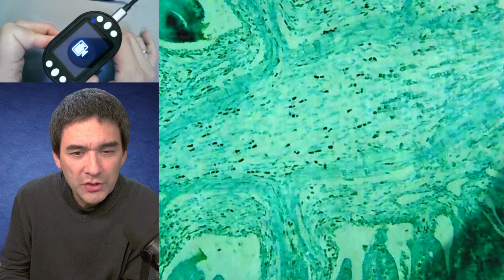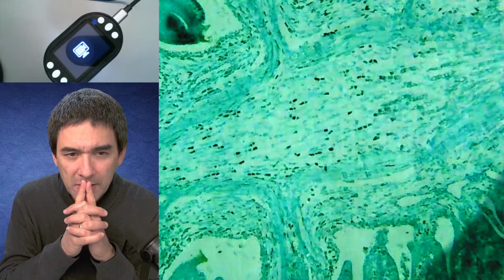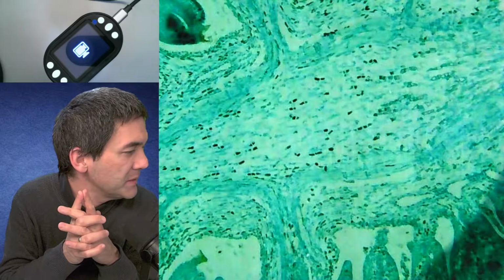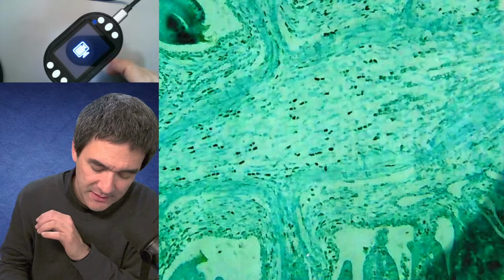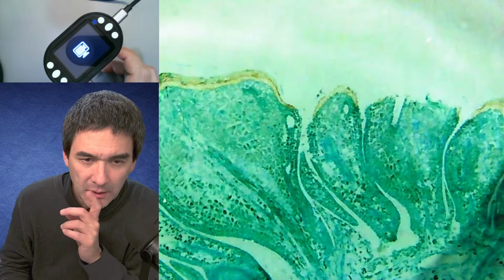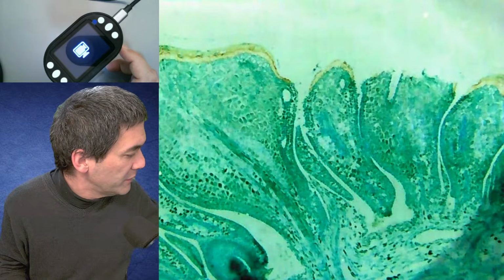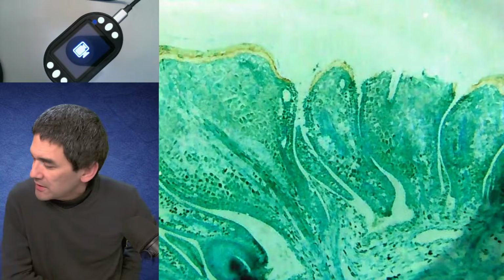The question that I have now is, what about looking at some live things? Because I do have a couple of live specimens as well that I want to show you. Also the water sample here, and that's something that we also would like to explore a little bit. But before I do that, I want to show you the possibility of observing. I don't have a good specimen here with me. Just a second.